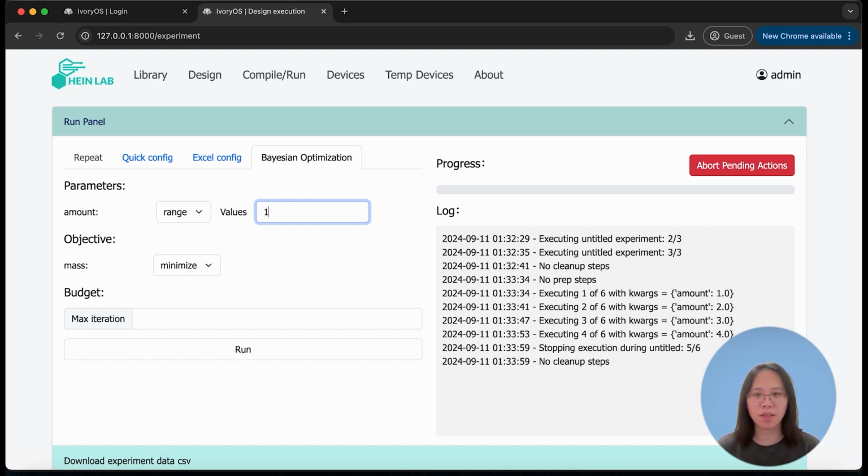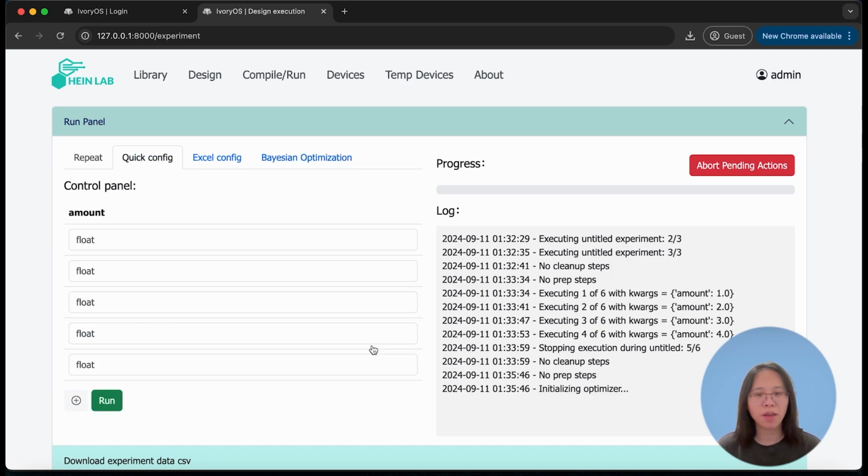So now we can just input the range for the objective. It has to be numerical, so we'll just choose to maximize. But for any non-numerical value, you can choose none for not optimizing this output. Now I will just simply run this 15 times to demonstrate how this works.